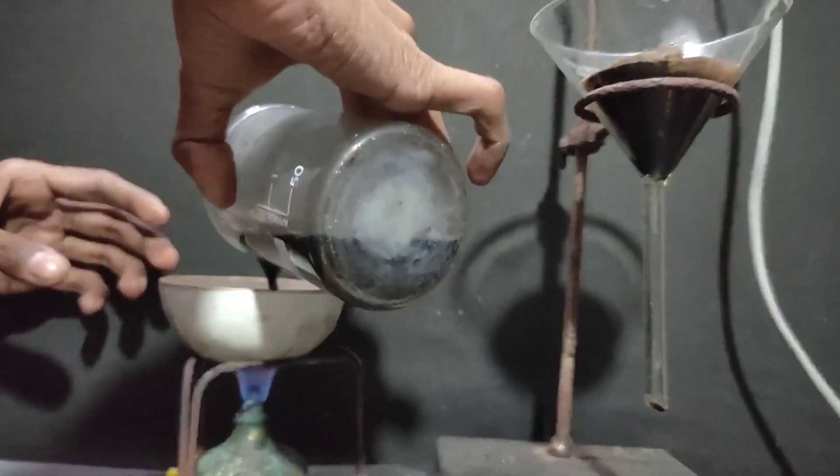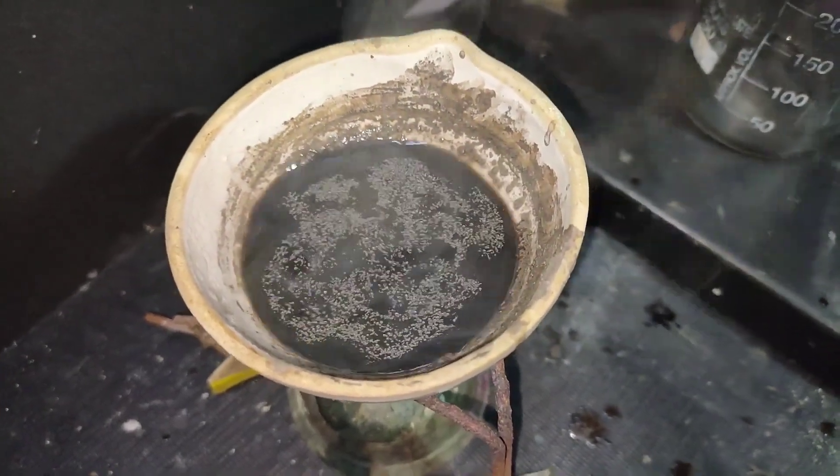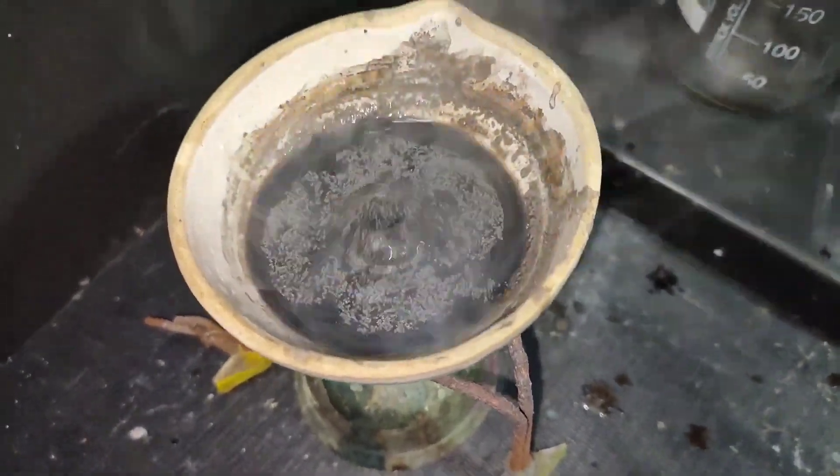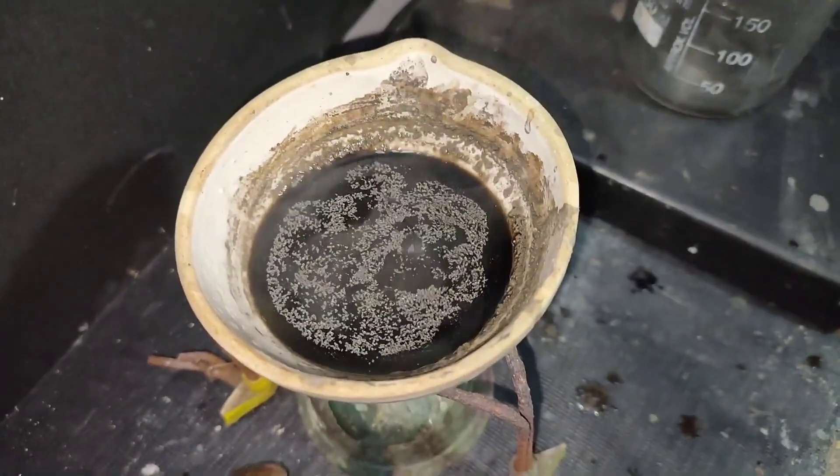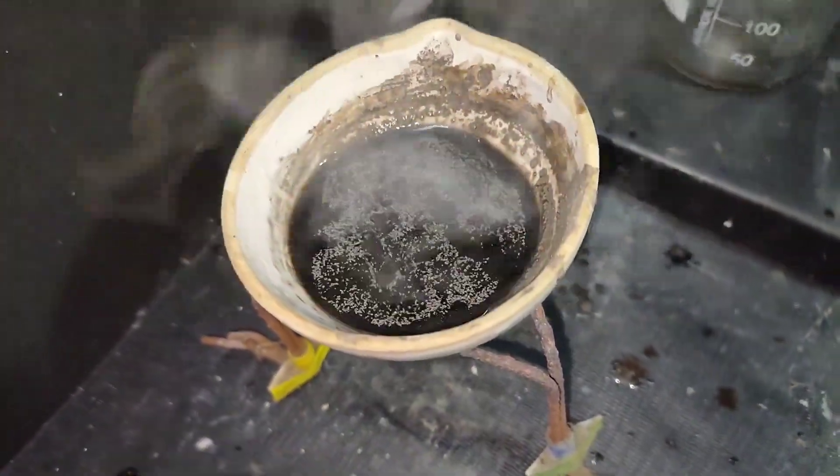I took the solution and concentrated it in an evaporating dish. When some solid crystals started to appear, I stopped heating and let it cool to 0 degrees Celsius.